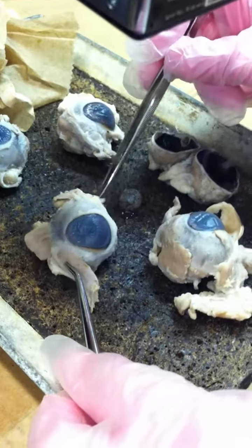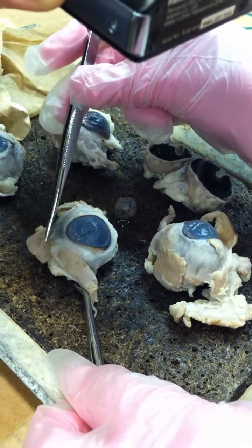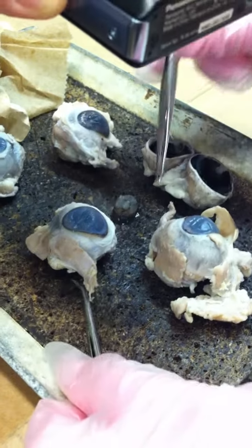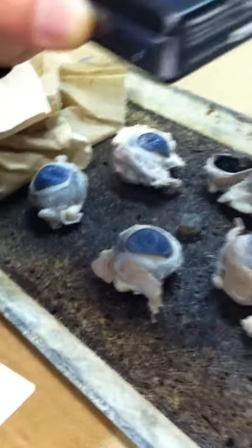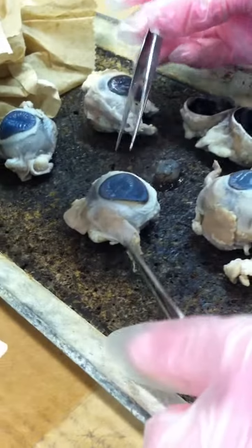So now looking at this eye, what would you say this eye is? If this is the inferior oblique, it's going from the lateral side into the medial side. The right eye. It's the right eye. Good, because then you remember that it's also a mirror image. It's not on your actual eye. You have to look at it as a mirror image.